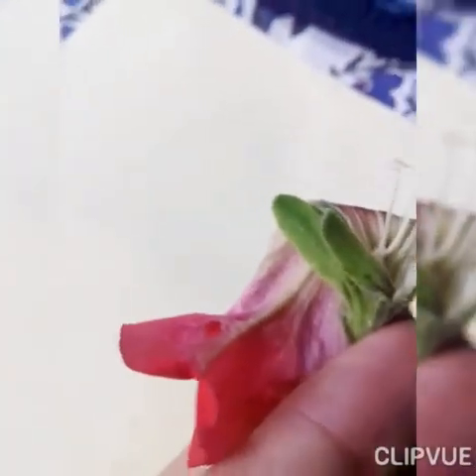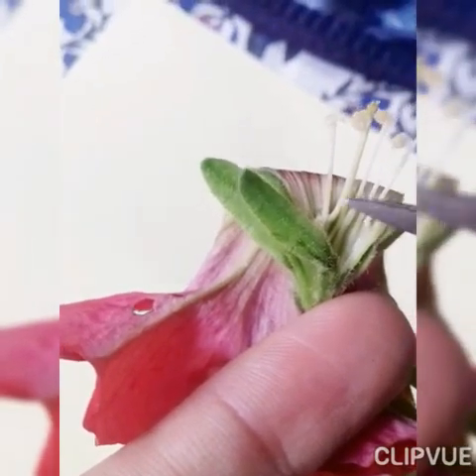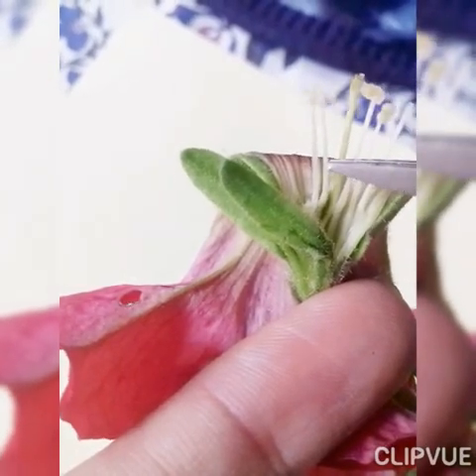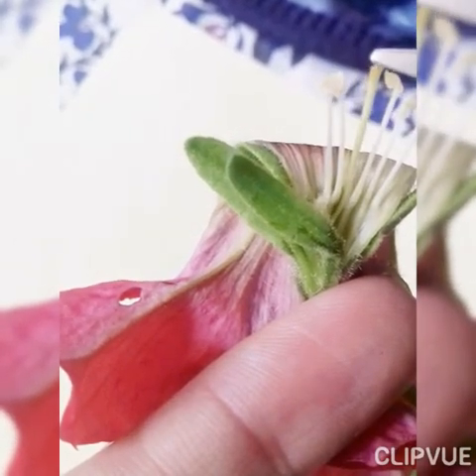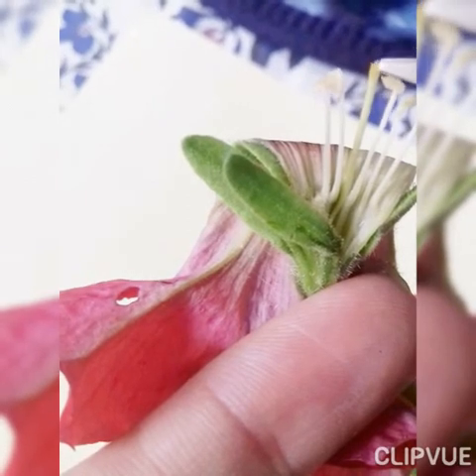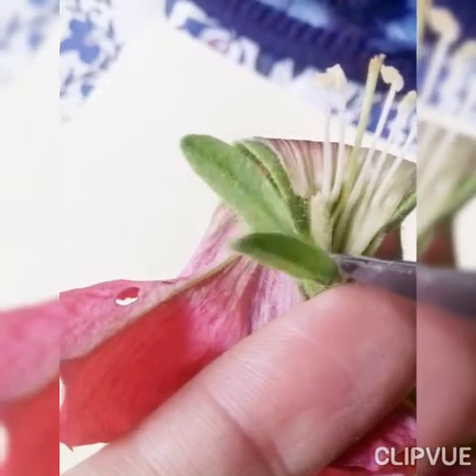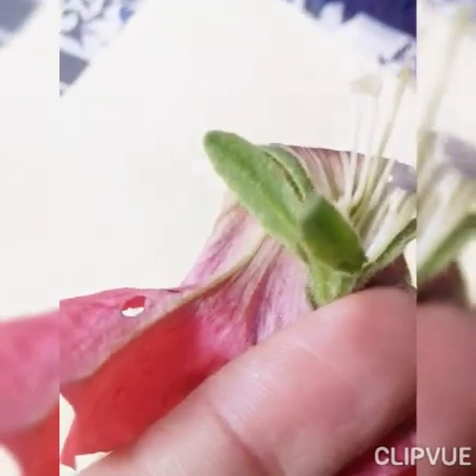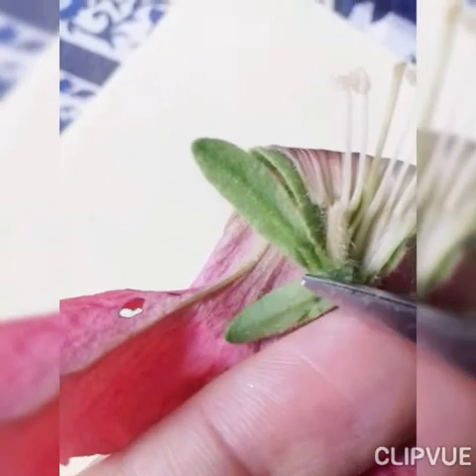Now I'm going to show you the female part of the flower by removing these stamens so that you can see clearly the carpel. The carpel has three parts: the stigma, the style, and the ovary. Now let's examine the ovary — you have seen the stigma and the style, so let's examine the ovary.